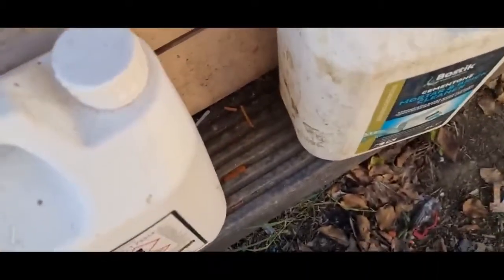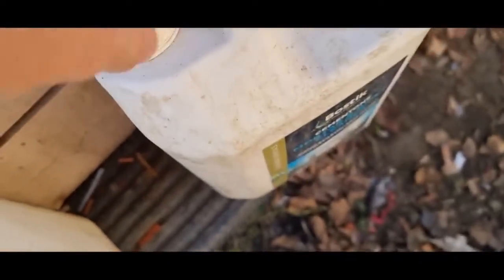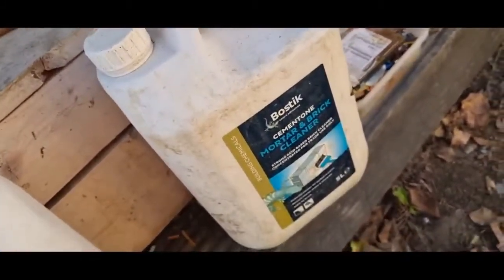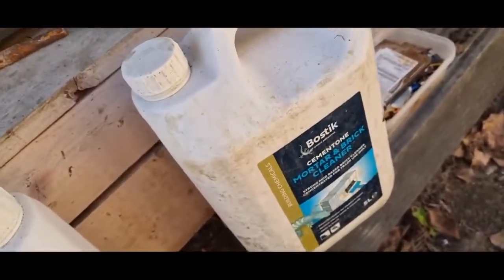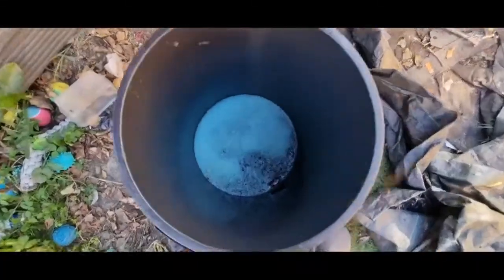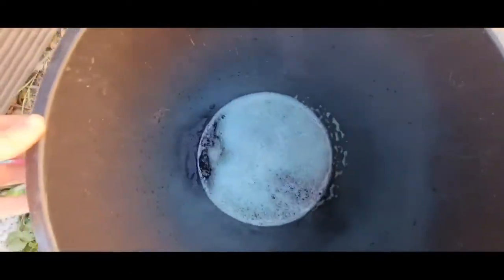So we'll be doing — I'll measure how many litres it is because it's filled up the copper and I've already got enough copper chloride to use for stuff, so I need to get rid. So here we have just under 5 litres, about 4.95 litres, almost 5 litres so close.